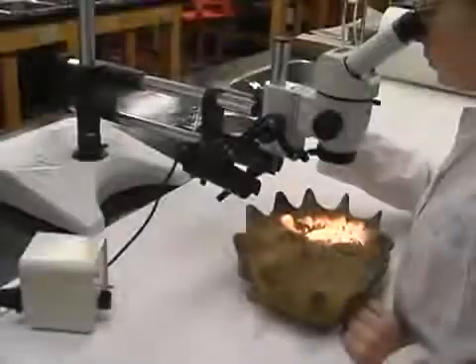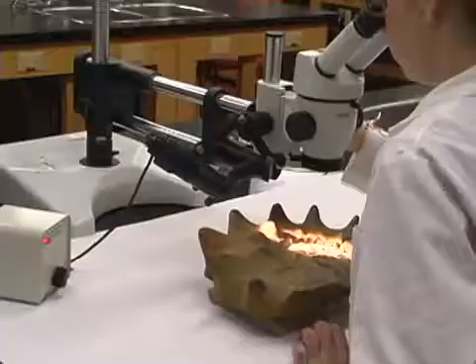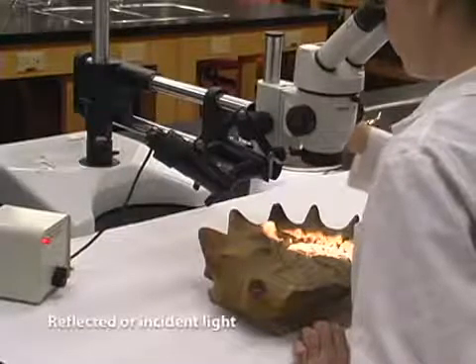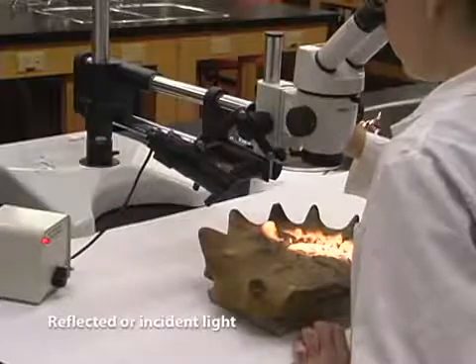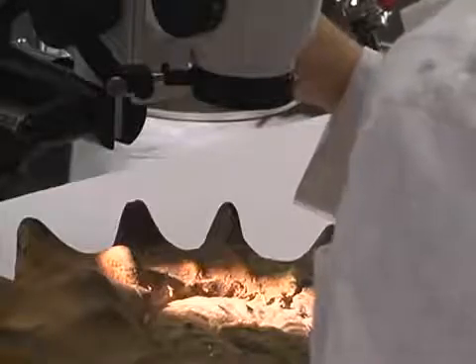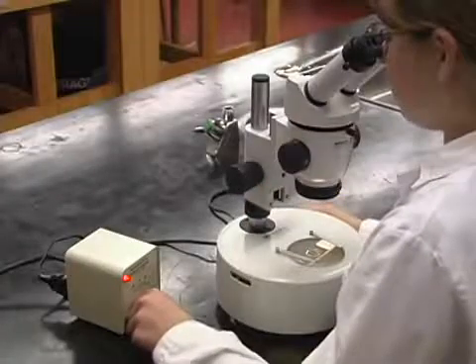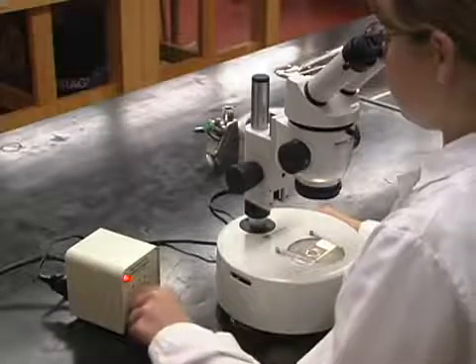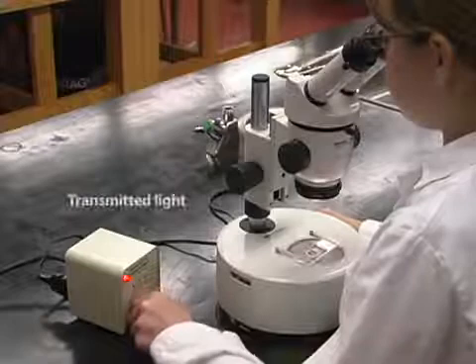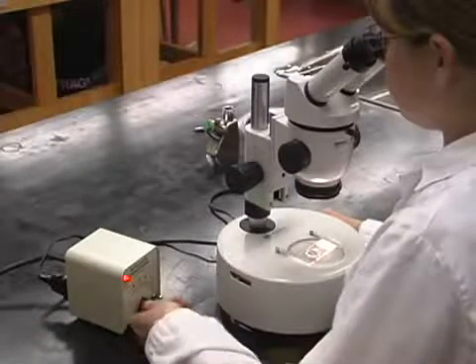If the object to be viewed is opaque, then light has to be shone on it and reflected back into the microscope. This means of illuminating an object is called reflected or incident lighting. Such lighting usually comes from above the object. A light source up high is usually the best for reducing shadows. If an object is transparent or can be made translucent by cutting it into thin sections, light can be passed through the specimen. This is called transmitted light. Transmitted light is supplied from below the object.